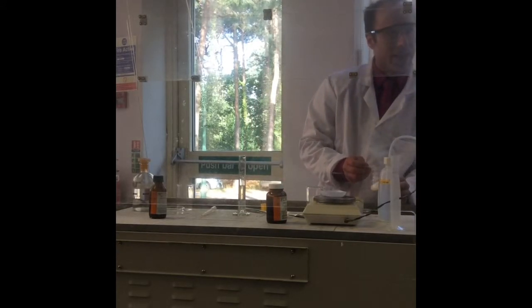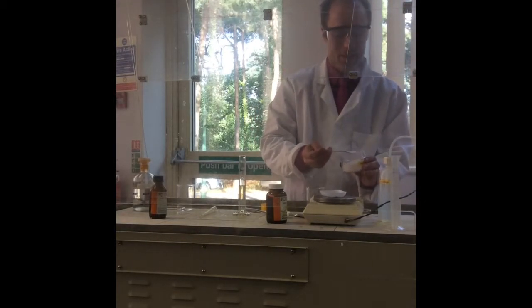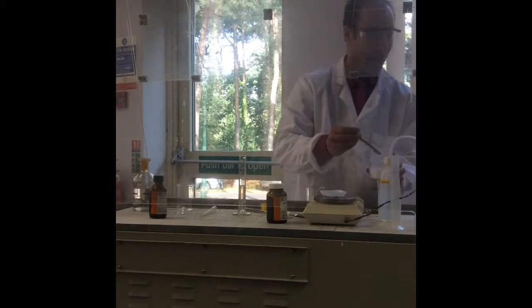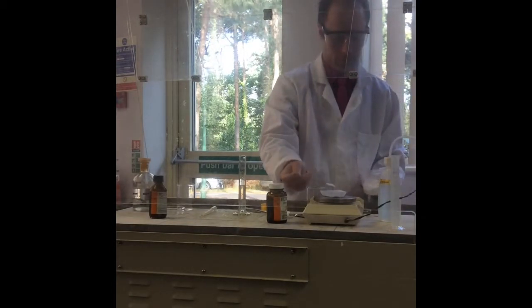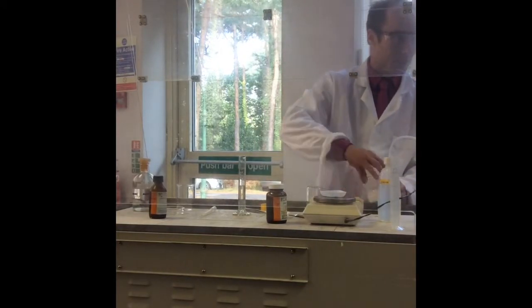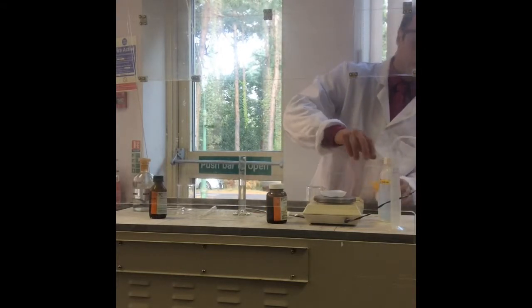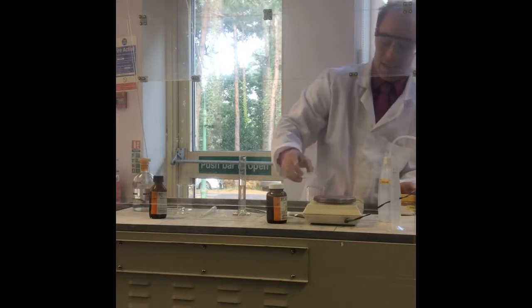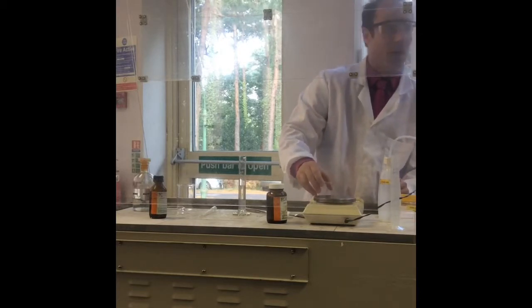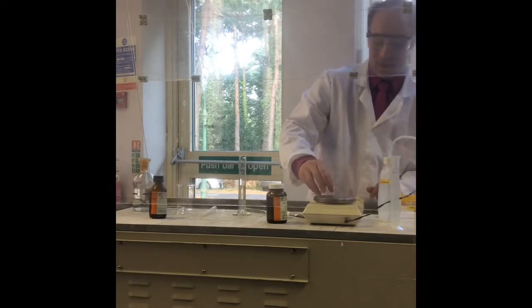If it was a diacid and a diamine, what would be my byproduct of polymerization? It makes an amide, and what's the molecule that's eliminated? Water. What's it going to be now if that OH has been replaced by a Cl? HCl. What will HCl do to a diamine? Destroy it. What does an amine act as? An amine acts as a base. HCl is an acid. So I would form the salt, and if I form the salt, it's not going to want to react at all.